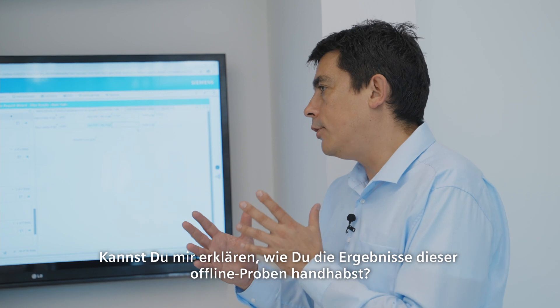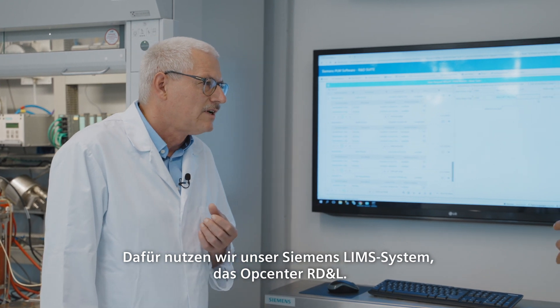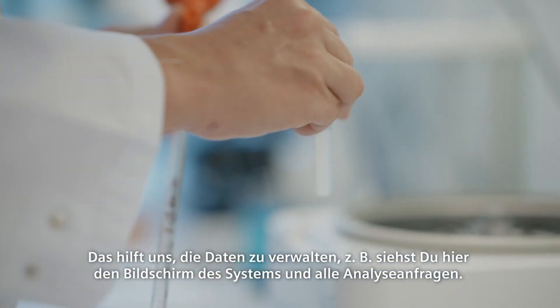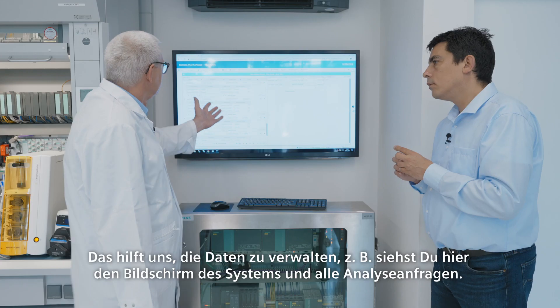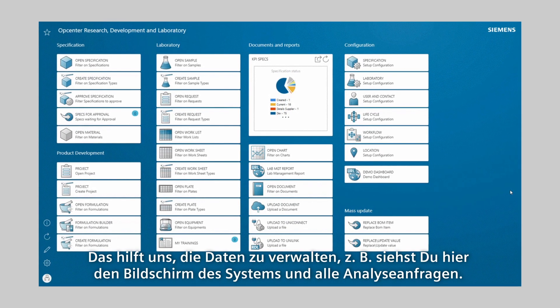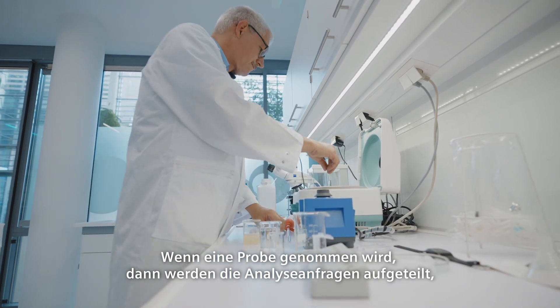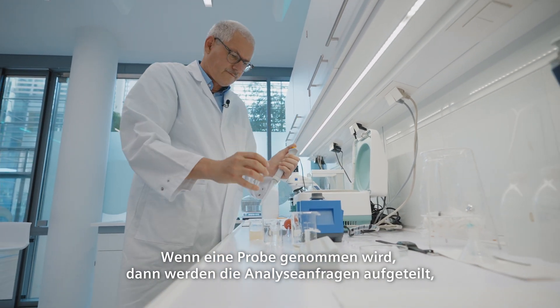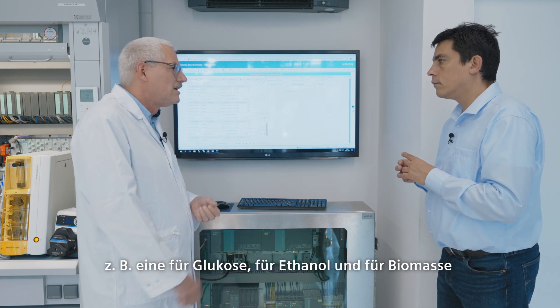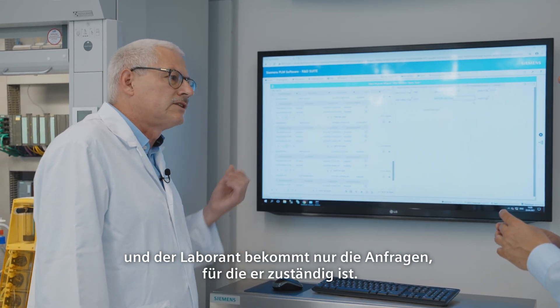Can you explain how you're managing the results from those offline samples? For this we use our Siemens LIMS system, the Opcenter RD&L, and this helps us to manage the data. For example, you can see here the screen of the system. On one hand you have all the analyzing requests, and when a sample is taken, the analyzing request will split into all analyzing processes — for example, one for glucose, one for ethanol, one for biomass — and the lab assistants only get the requests which they are responsible for.